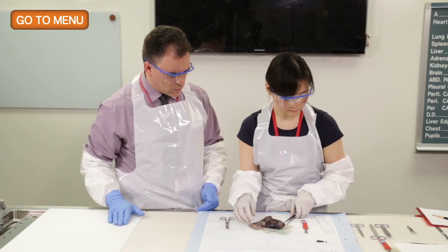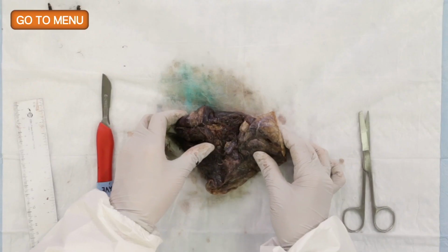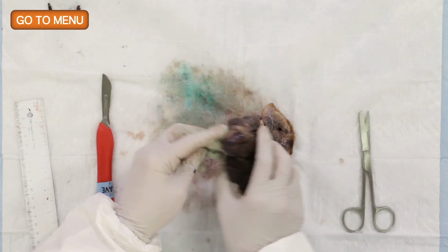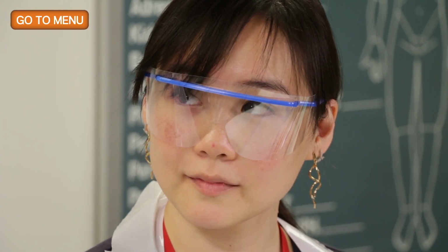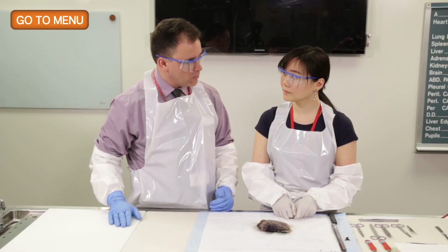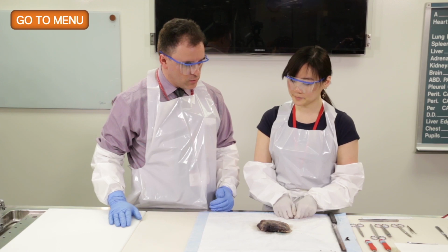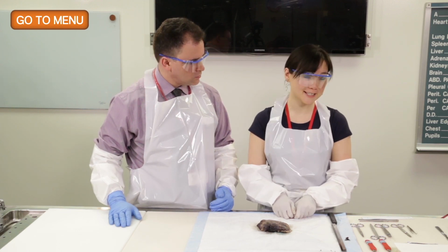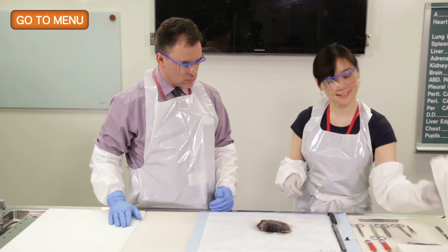Okay, so now we've identified lymph nodes, and we're going to move to the tumor mass itself with the plane of section like you described to expose the longest extent of the tumor so we can get an accurate measurement. So why don't you go ahead and do that with your very sharp blade. Sounds good. Personal preference, I'm going to just lay down some towels.